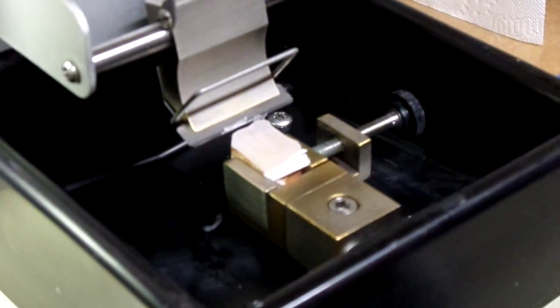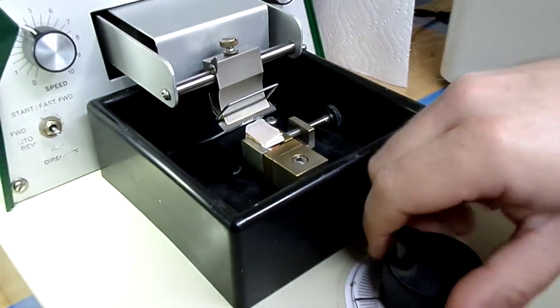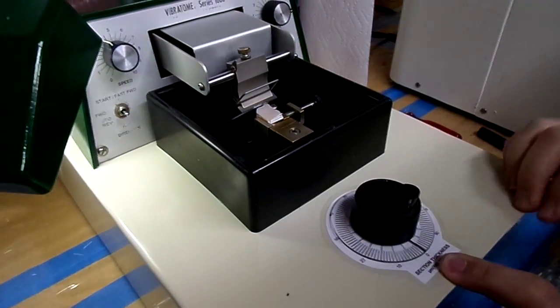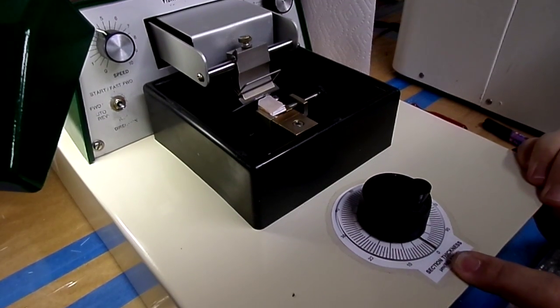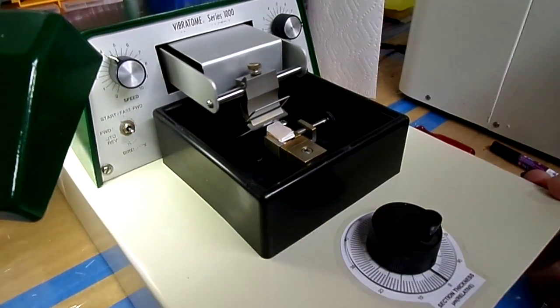So since we did it at 100, I'll go ahead and rotate it again. One full go around for another 100 micron cut. Alright, start it up.